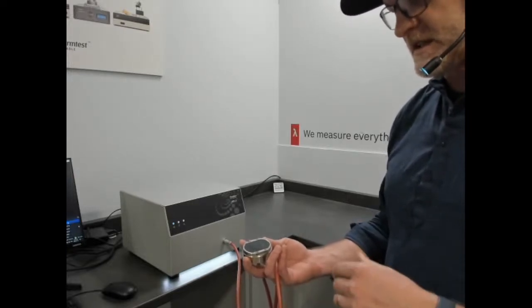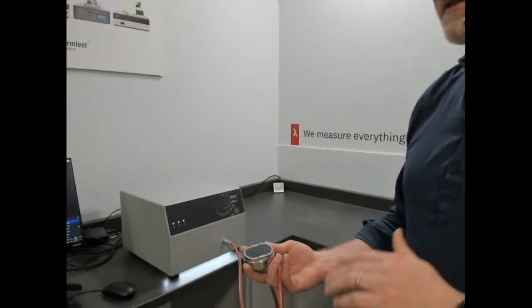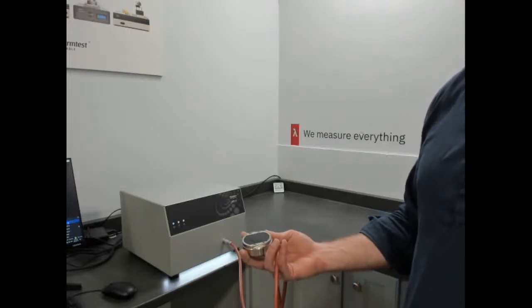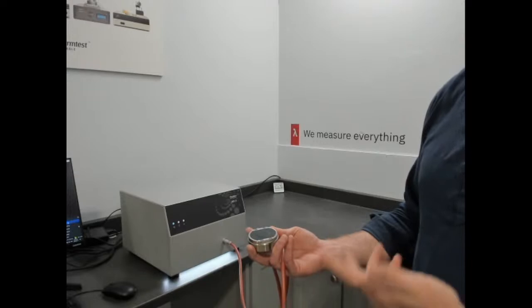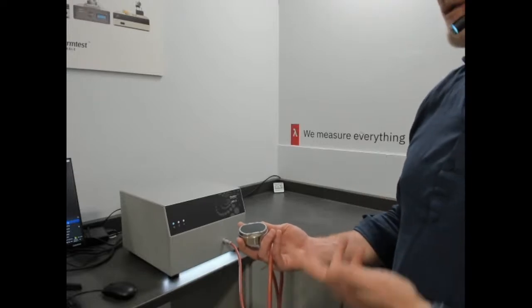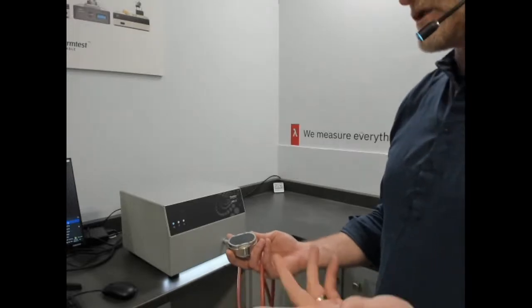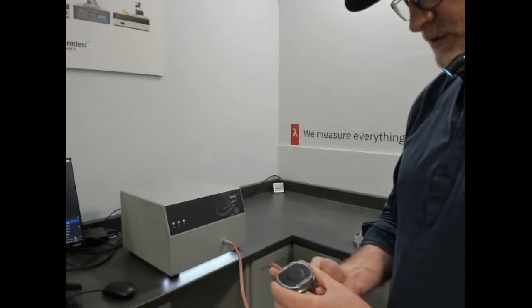It can be very misleading and confusing. But for the use of thermal effusivity for measuring the sense of coolness, it works, at least conceptually, and it provides those designers of materials that want to influence the sense of coolness or warmth a way of describing the change in that surface haptic sense of coolness or warmth.